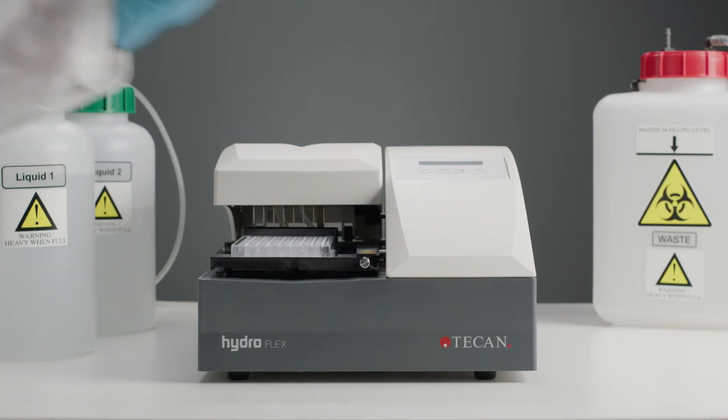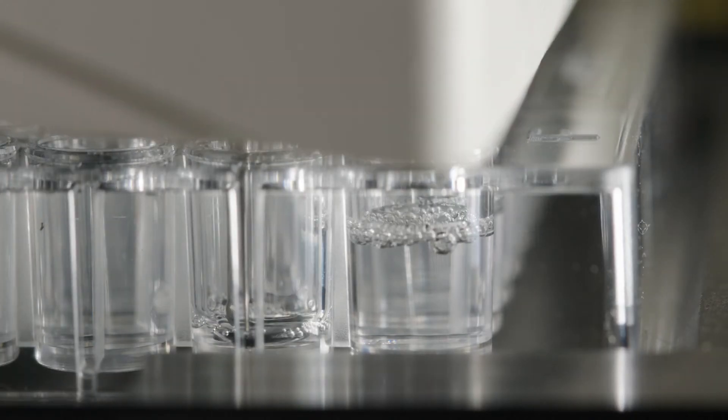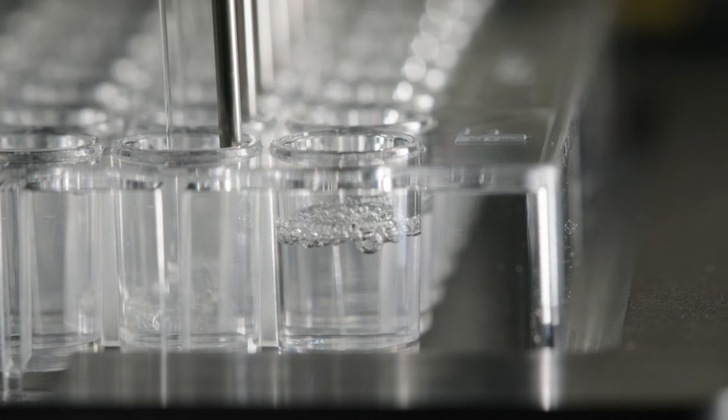When you have set all the plate parameters correctly, press OK. Make sure to check your plate offsets when transferring plate definitions from one instrument to another.